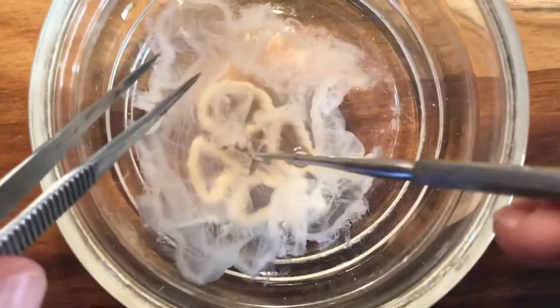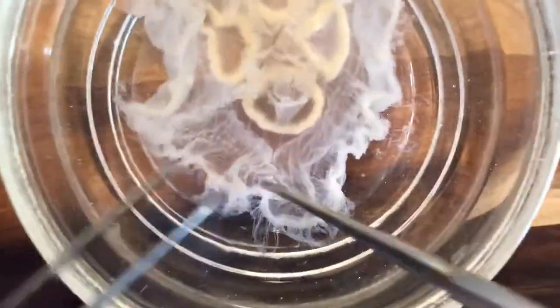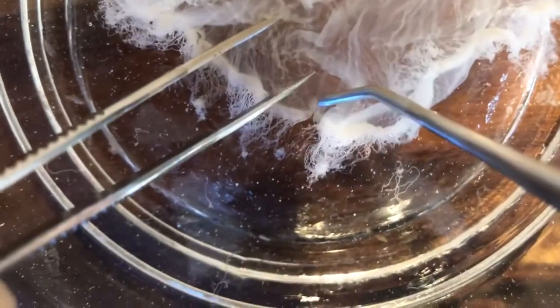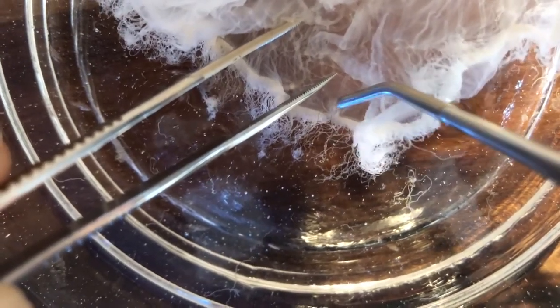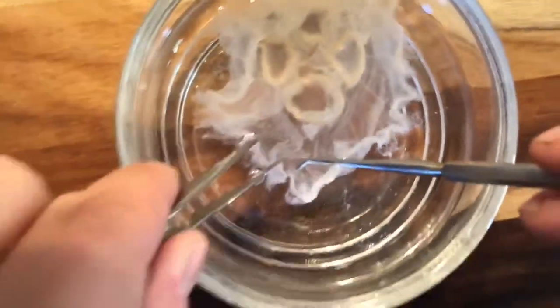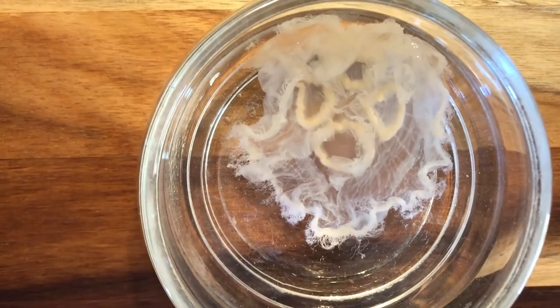Gastric pouches are a little too small to see, but they are located within the gastrovascular cavity. Going back out towards the margin, our final structure is one of the most difficult to find — even difficult to find on a microscope. There are eight of them, and this structure is called the rhopalium. It is one of the simplest nervous structures in the animal kingdom, but it does help the jellyfish perceive its environment. It contains statocysts, which help the jellyfish orient itself right side up versus upside down, and the rhopalium is also able to help sense light versus dark.